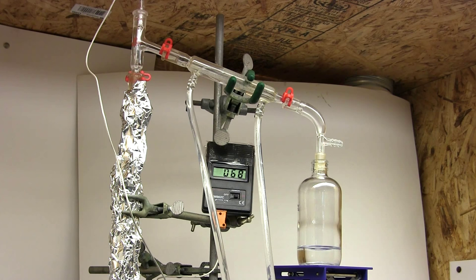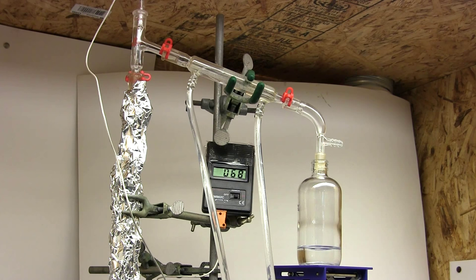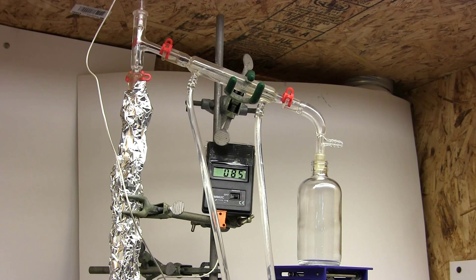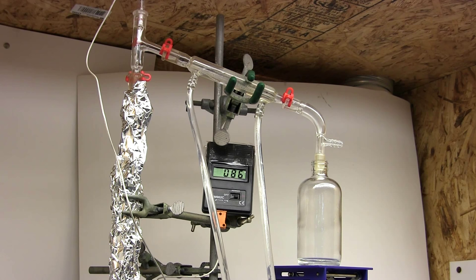So once again the heating is insufficient to vaporize this particular composition of components to reach the top of the column. Either that or we're transitioning to toluene now. I'm going to change out the receiver and slightly increase the heat. And there we go, as you can see distillation can be quite a time consuming headache. Especially if the particular mixtures you're working with exceed the capabilities of your equipment.